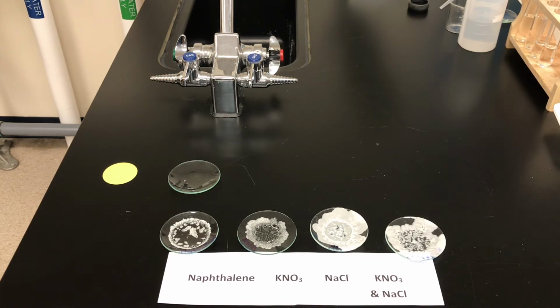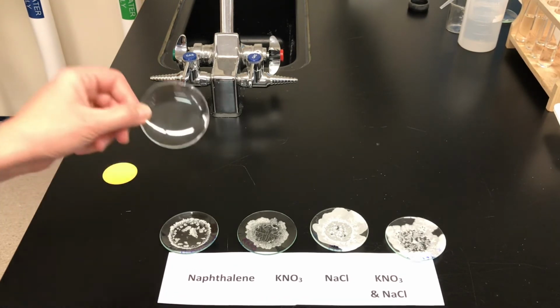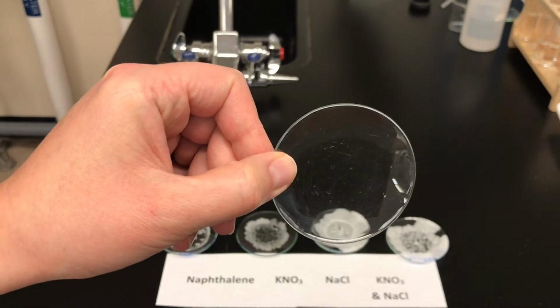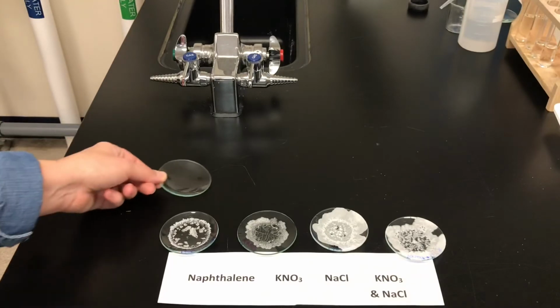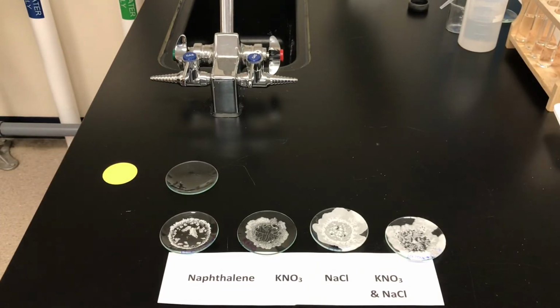You might recall from earlier, Mr. Patno had mentioned that naphthalene can sublime. So what happened yesterday before the end of the day was that the 2-propanol, the alcohol, which we used as a solvent, had completely evaporated, leaving behind the solid naphthalene. When we came back on the second day, no naphthalene was left on the watch glass, so it did in fact sublime. The solid crystals completely disappeared and turned to gas.